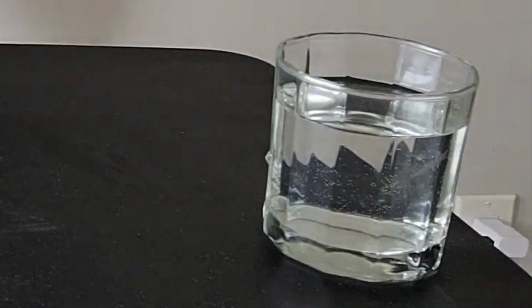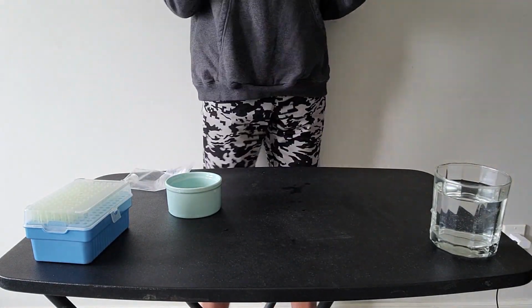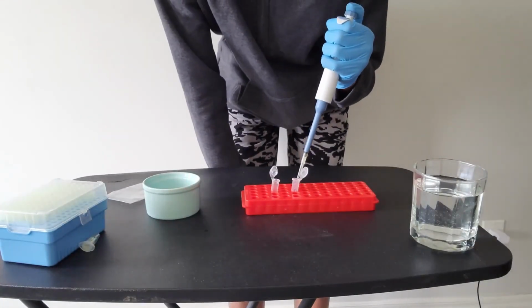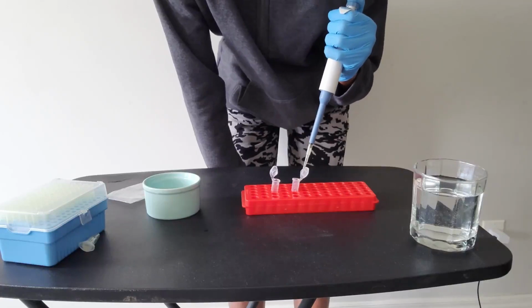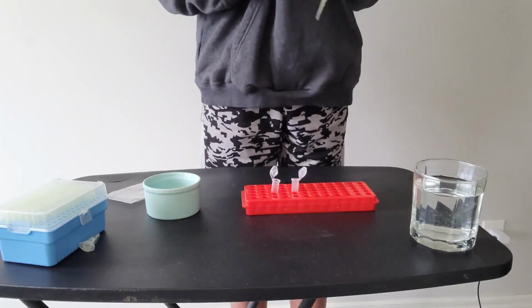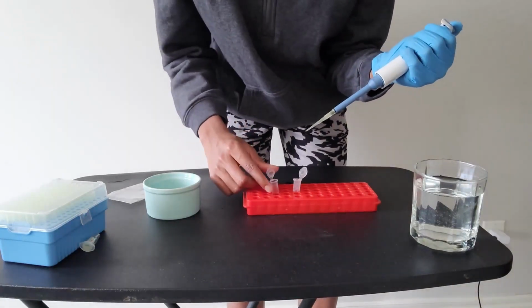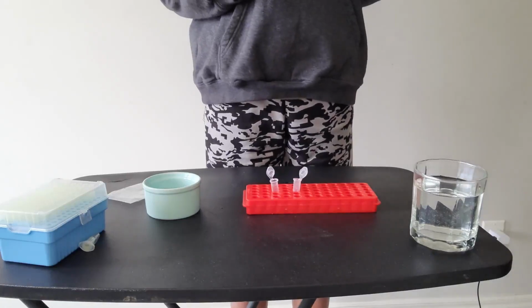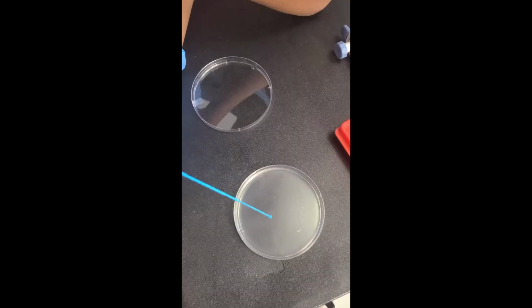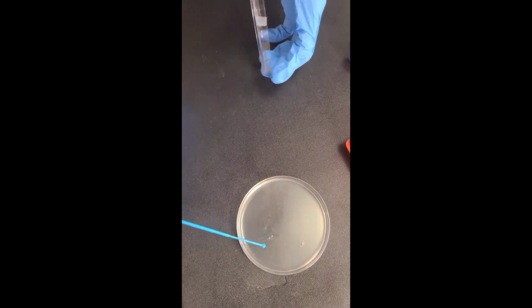The next step is to add 1.5 milliliters of tap water into an LB medium microcentrifuge tube and shake it until the LB powder is dissolved. And then pipette 250 microliters of the solution into the competent cell mixture tube. This will aid the bacteria to grow more quickly. Incubate the competent cell mixture, giving it time to recover from the heat shock and allow the CRISPR system to take action. Finally, pipette all of the solution inside the competent cell mixture onto a strep plate to see if our experiment works.